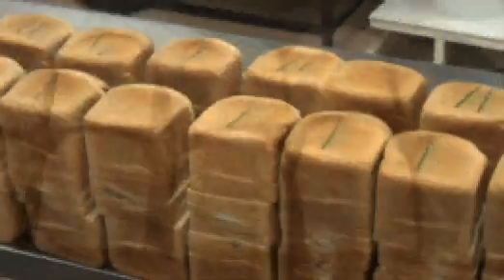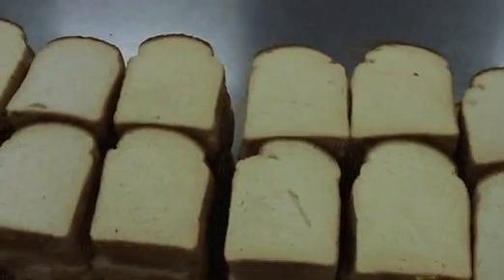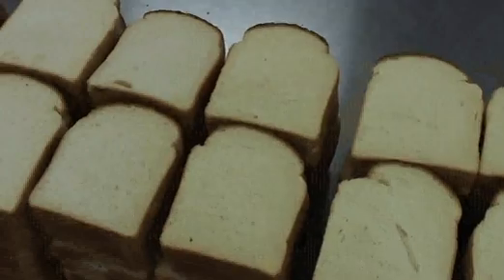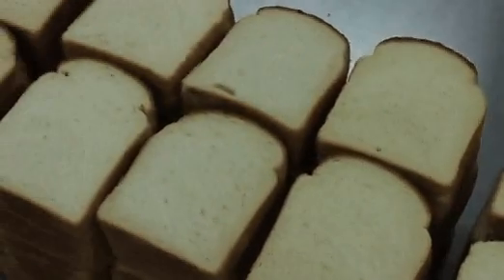Differences between individual loaves, their structure and physical characteristics are clear to consumers and particularly to expert bakers. However, one of the areas that we have worked on has been developing objective methods of characterising bread structure.